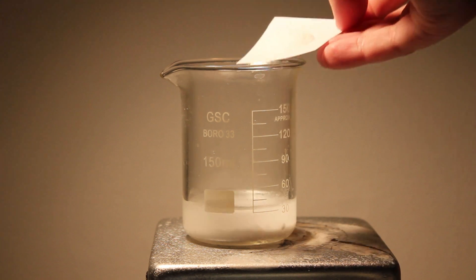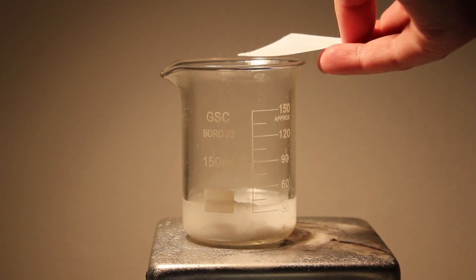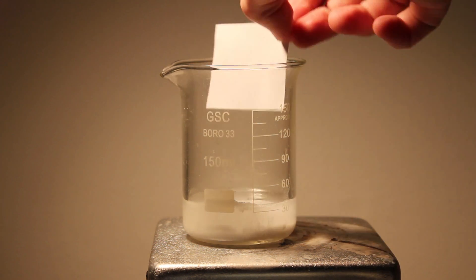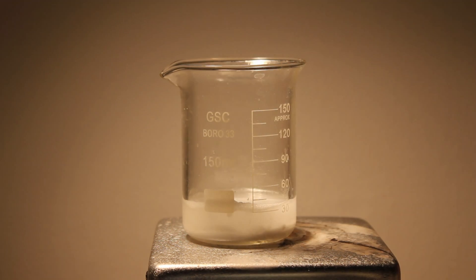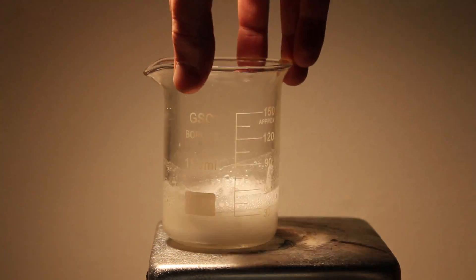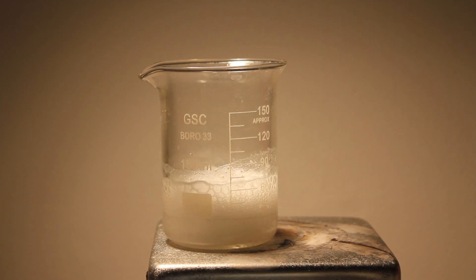Next, 1.69 grams of sodium bicarbonate are added. This will produce sodium acetylsalicylate. This will start to bubble as the production of carbon dioxide begins.